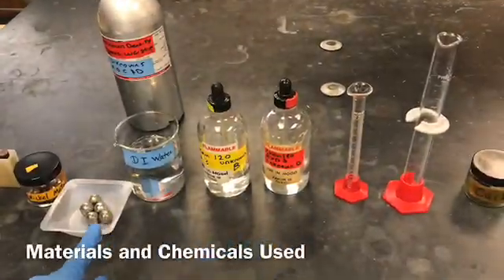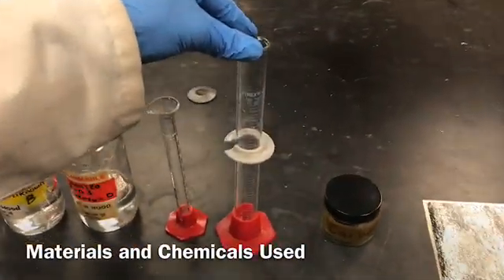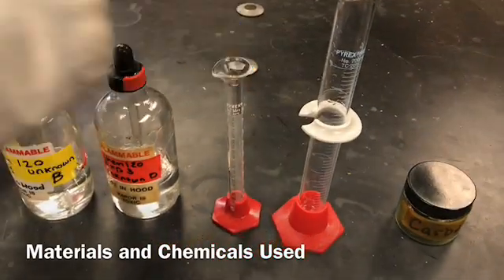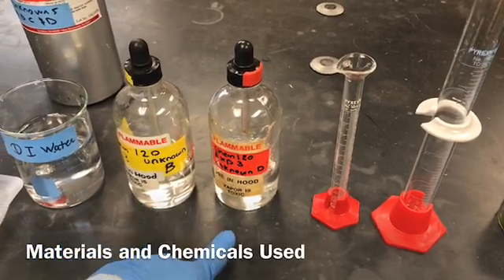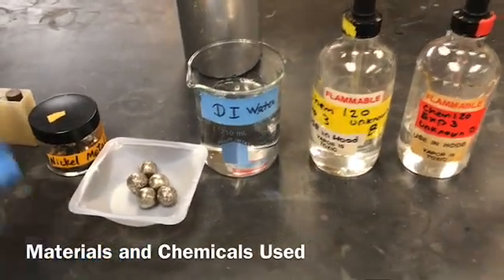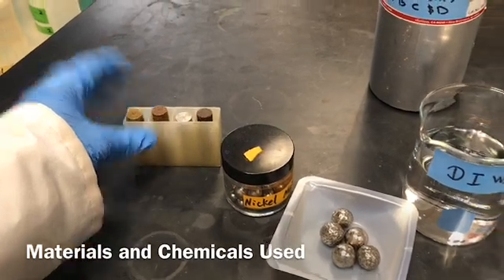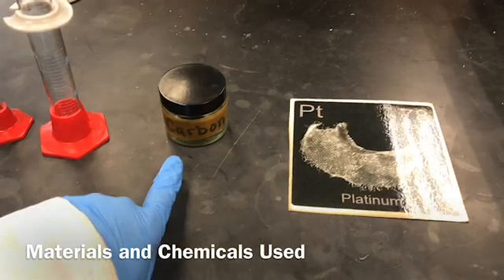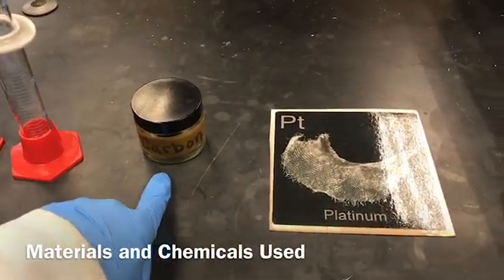So what we need in order to do this experiment: measuring cylinders, 50 milliliter and 10 milliliter, organic liquids, unknowns. I'm going to take B and D, deionized water, nickel metal, and the metal cylinder. And one more thing which I already mentioned before, the different elements in the glass bottles or in the card form.